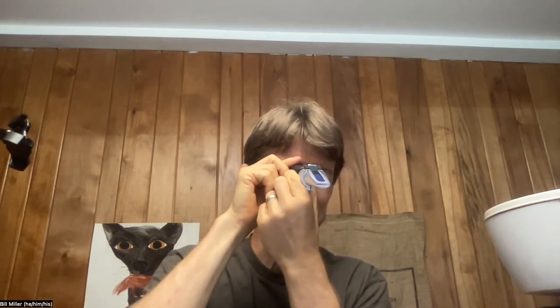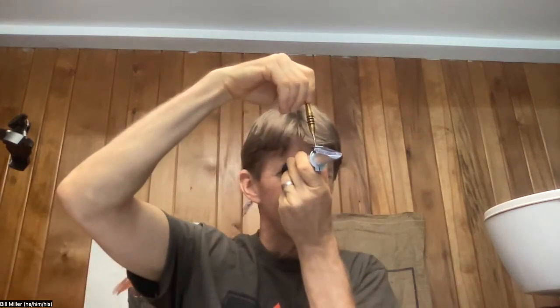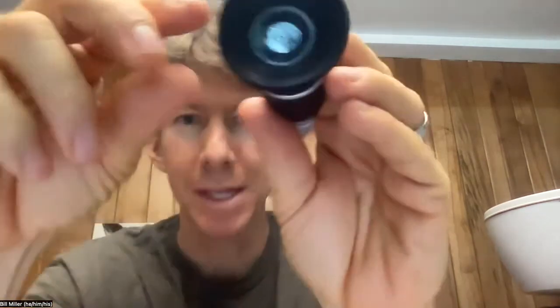Well, you can see it's just on the edge of the blue. I'm going to fix mine a little bit. That was the wrong way. Now that transition is right — right on. Come on. Right on that. I raised it a little.